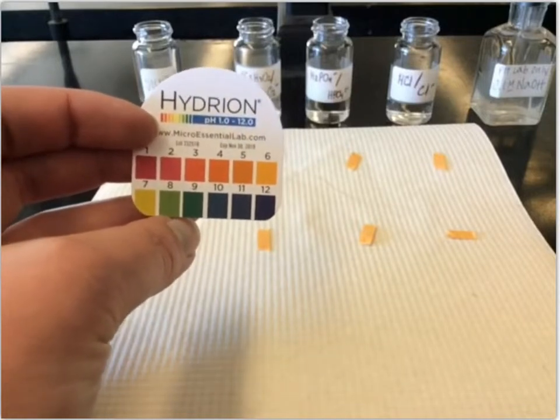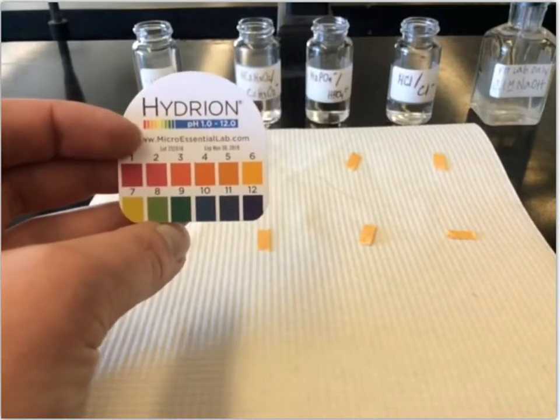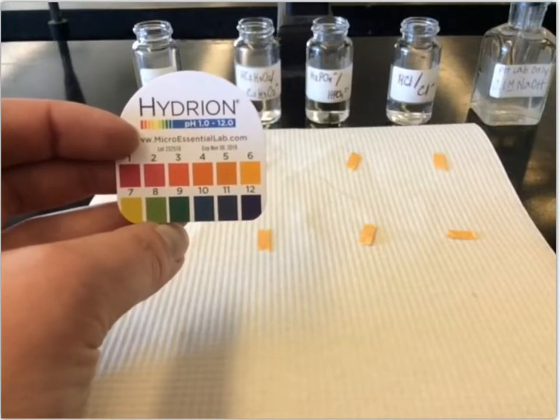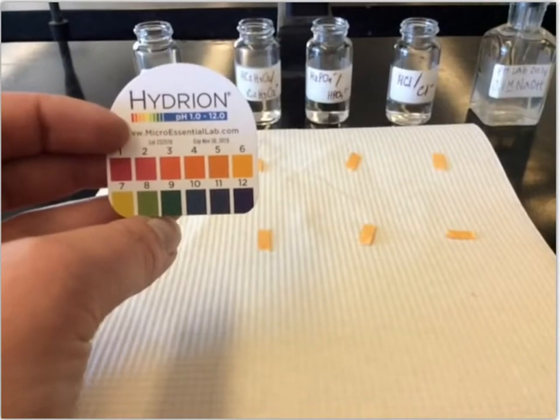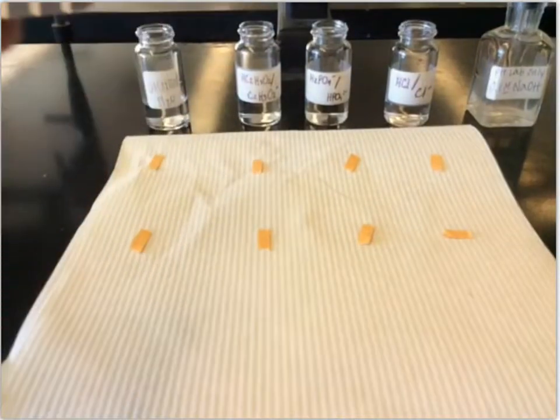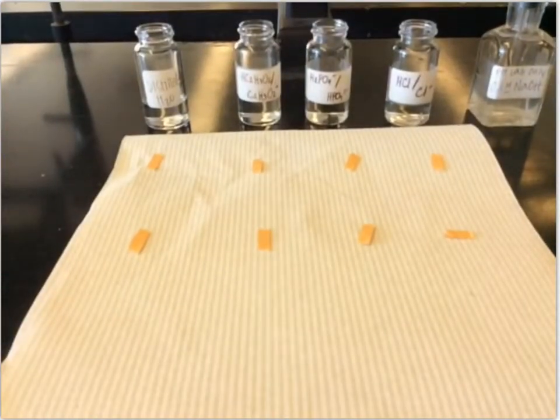We're just going to get estimates of the pH so we can get a general idea of where we started and where we went. And then from those pH values, we can quantify the approximate hydrogen ion or hydronium concentration in these solutions, and understand a little bit about how much the different combinations affect how much that changes.